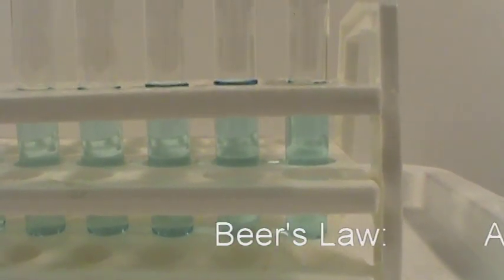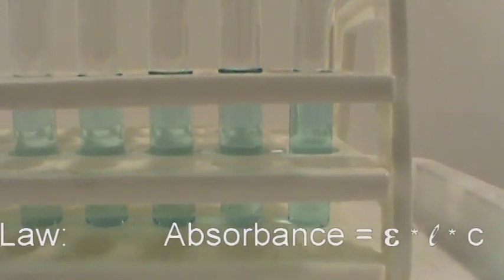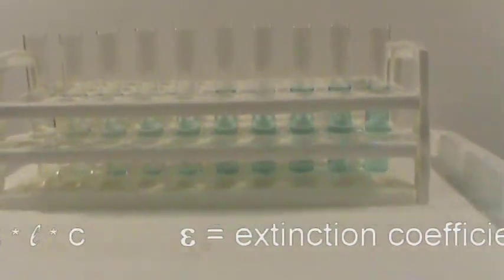That's because when I prepared these solutions, I prepared them by using more and more food coloring as I went across this series of 10 tubes. So the concentration increases, therefore the absorbance increases, therefore the intensity of the color increases.